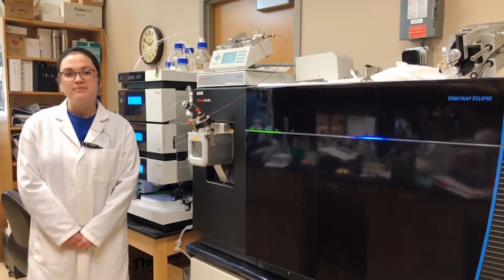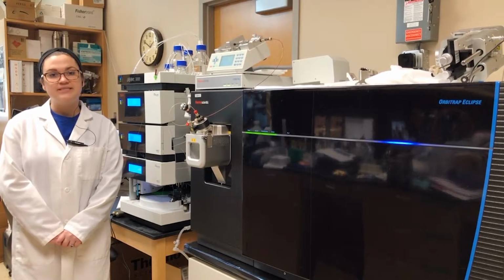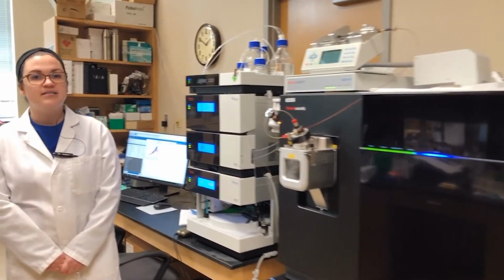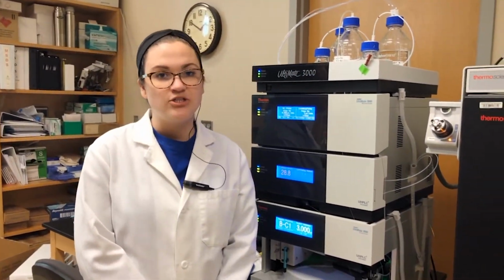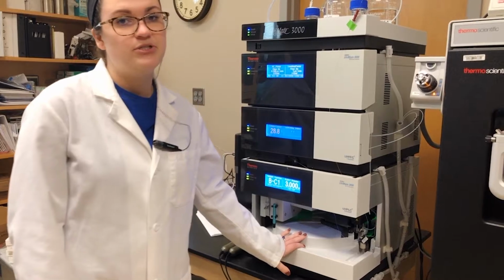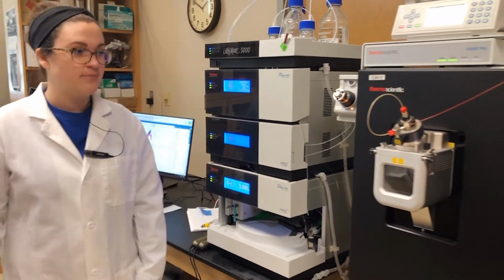Hello, my name is Lauren Pepi, and I'm a postdoc here at the CCRC. I'm standing in front of our newest LCMS system, and this was funded thanks to GlycoMIP. The LC portion of this is an RS-LC nano-LC system, and so this uses very small injection volumes to get a lot of information out of, and this helps us to conserve sample. This has an auto sampler, so we can do automated injection and look at many samples back to back.